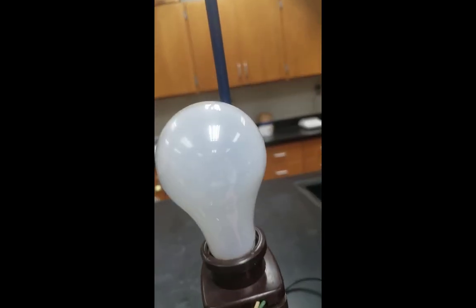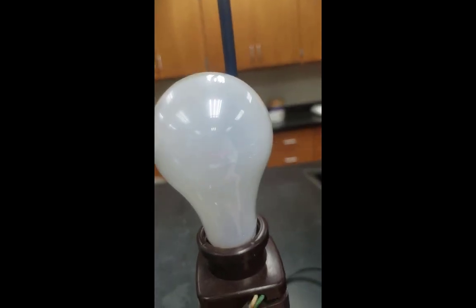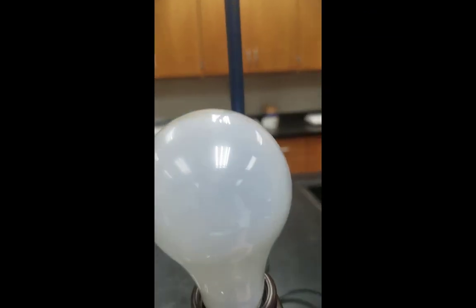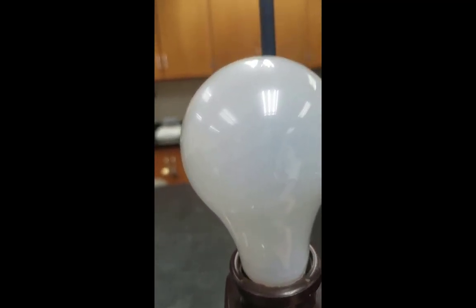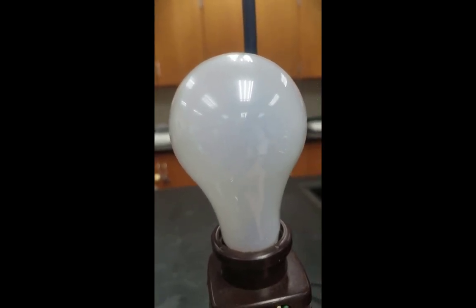Let's take a closer look. And right now we're putting the solution just under it. And if you look just about two-thirds of the way down, you might see a little bit of glowing fragment, but it's very, very hard to make out. But you just have to take my word for it. There is a slight glow right there.